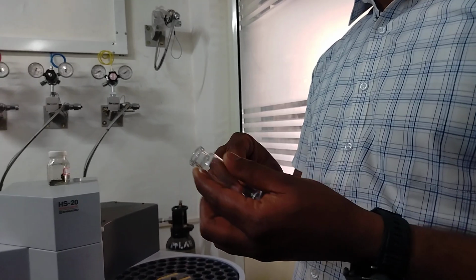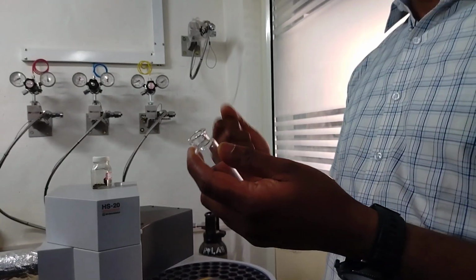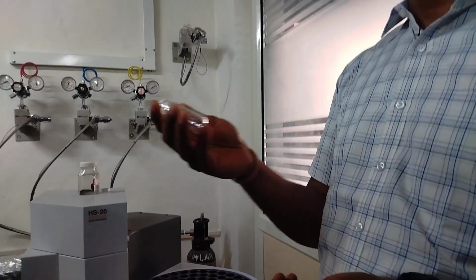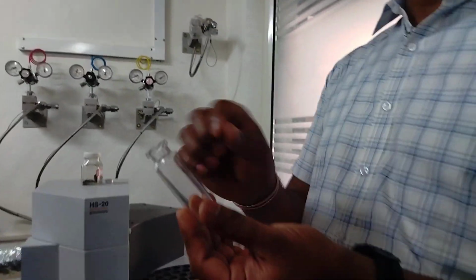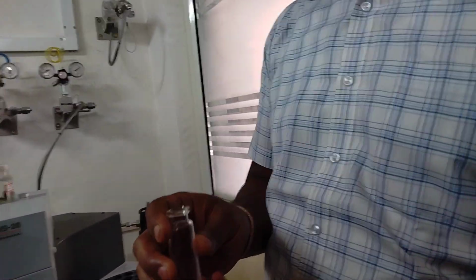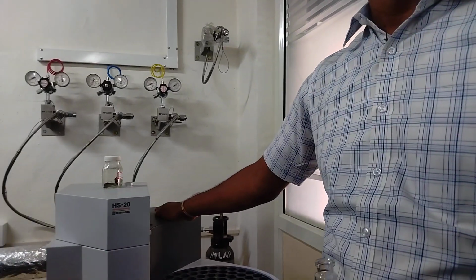Even blood also. See, a few days back, some drug case was there. They'll collect the blood and then put it inside this, and then what type of drug has been used can also be analyzed. This is a direct method. The drug has to be volatile. If you put it directly, that's what, the drug has to be volatile. Okay. What is the source of heat? Source of heat? It is a heater, a general normal cartridge heater.